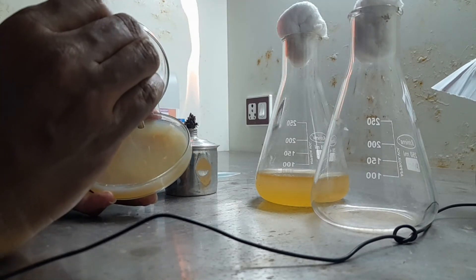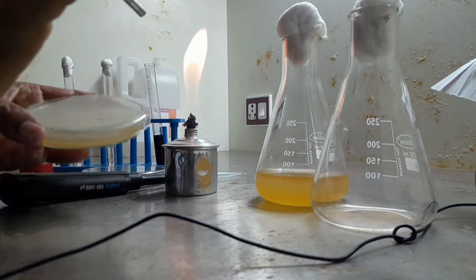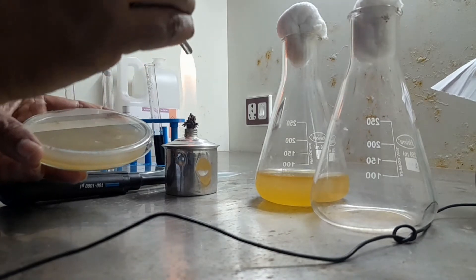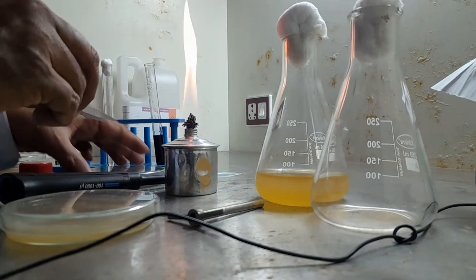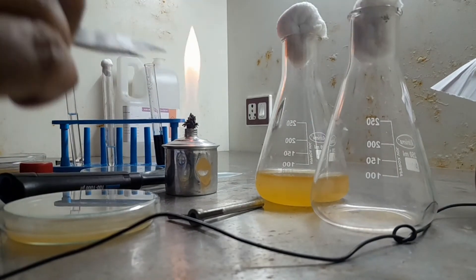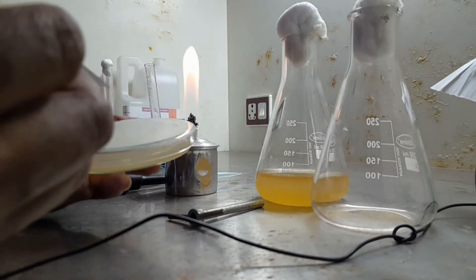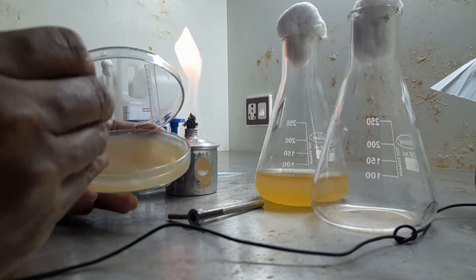Then, using forceps or using a sharp needle, agar block has to be taken out. Use a sharp needle. If you just insert, the whole pieces, you may get it out.